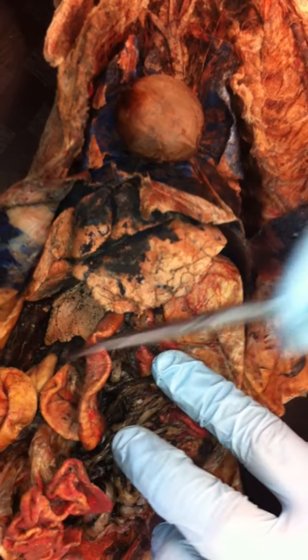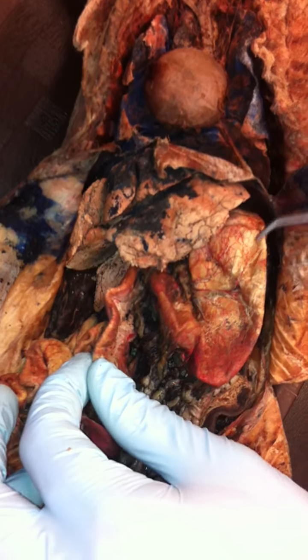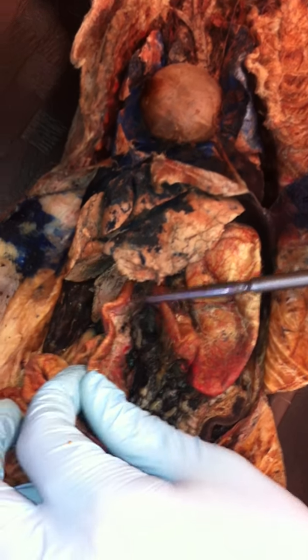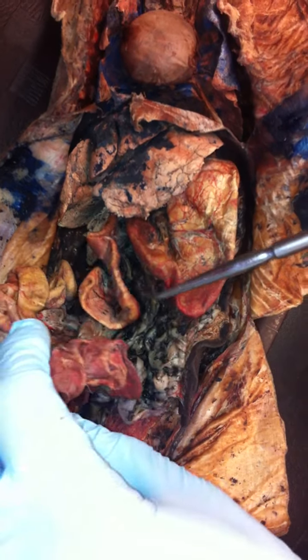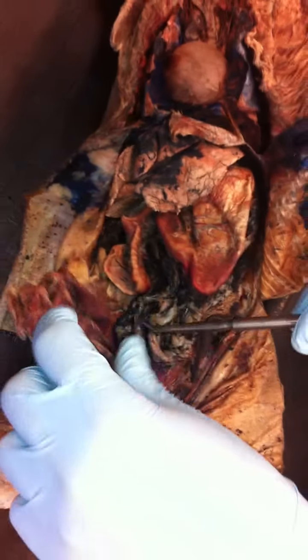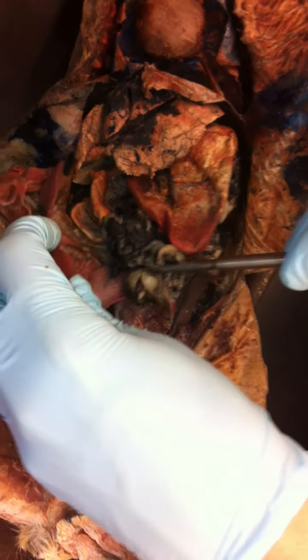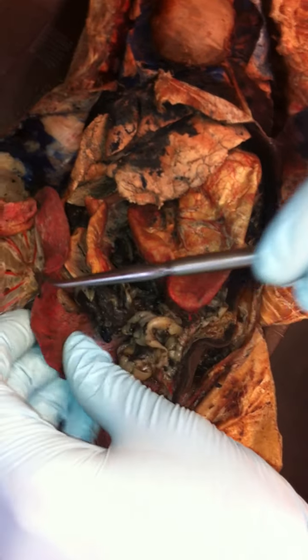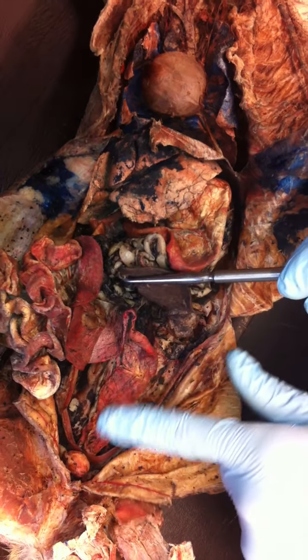If you follow the stomach down, right around here is where it ends, and it goes into the small intestine. The first part of the small intestine is called the duodenum, or duodenum, some people call it. And then you can follow the small intestine, which everyone should know is this really convoluted area. And then it will thicken out on its distal end as it becomes the large intestine, okay? And you can see it goes all the way down to the colon, okay?